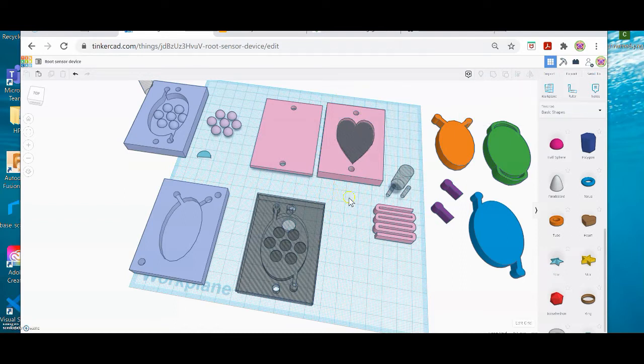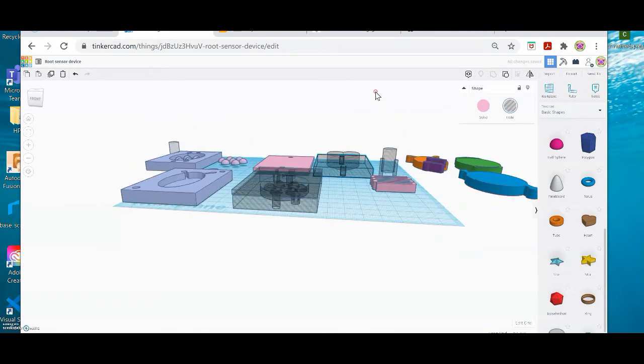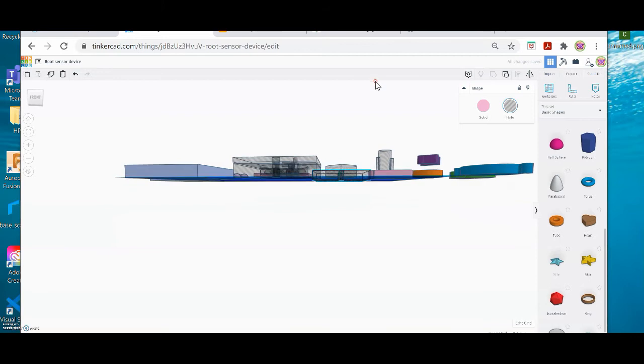the pink form. I'm just going to turn sideways a little bit so you can see this particular feature of each object. So that black cone, again, is to lift up and down. Okay, so I'm just going to move that cone a little bit down. And if I want to see really how deep it is into this shape, I can turn my pink shape hole too. This is just a little trick. And then I could turn it totally sideways, and I could see how deep it's going down.